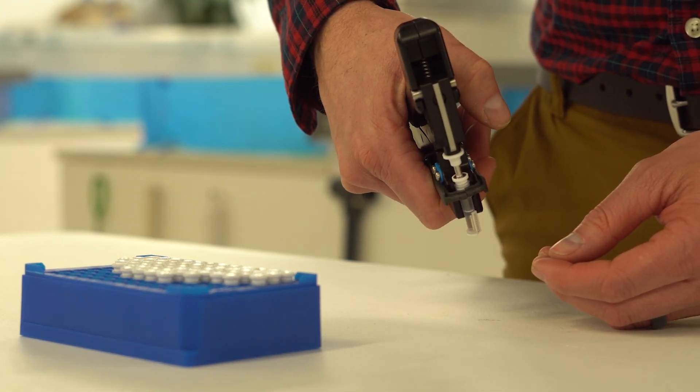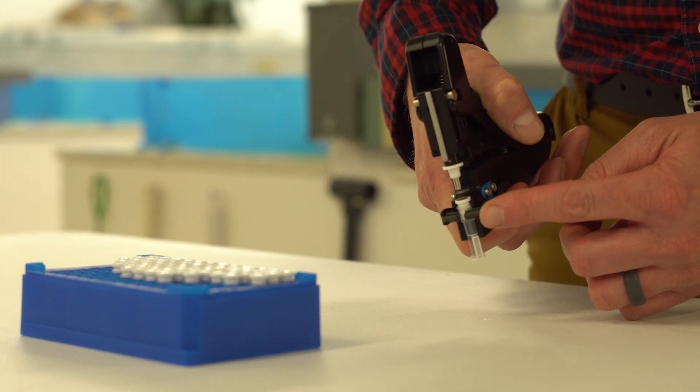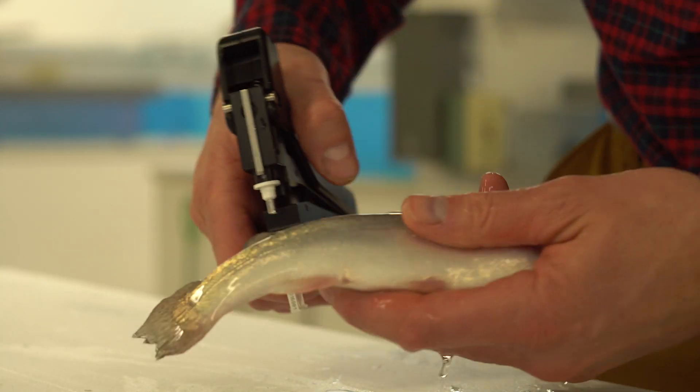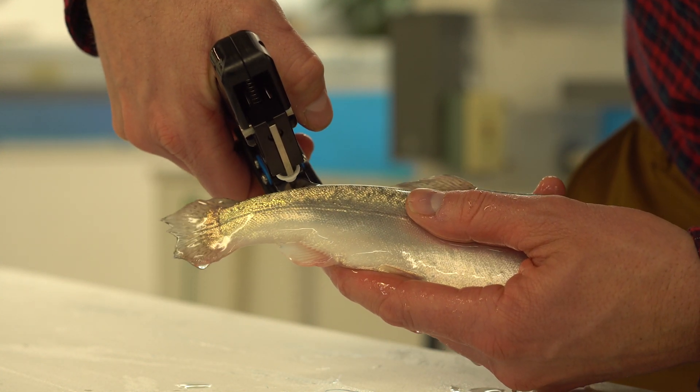Make sure you are not squeezing the applicator too hard as this will cause the jaws to open, resulting in an unusable sample. Be sure you are following proper fish welfare protocols when anesthetizing and handling fish.